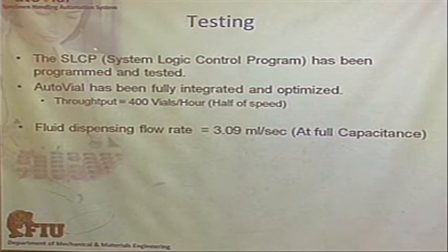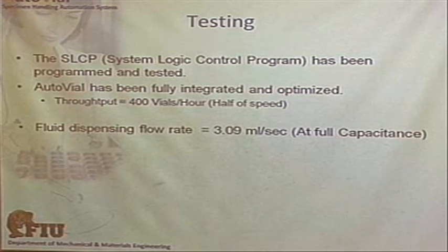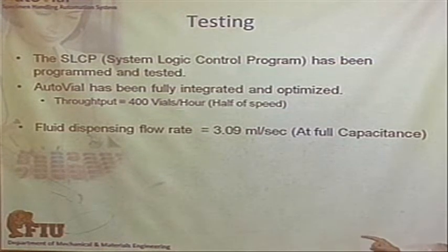As to the testing, the program worked successfully. We programmed it, we tested it. The AutoVial is fully integrated, you can see it there, and it's actually optimized. We were able to achieve a throughput of 400 vials per hour, and this is at half speed. Right now it will run, as you will see later, at half the speed.